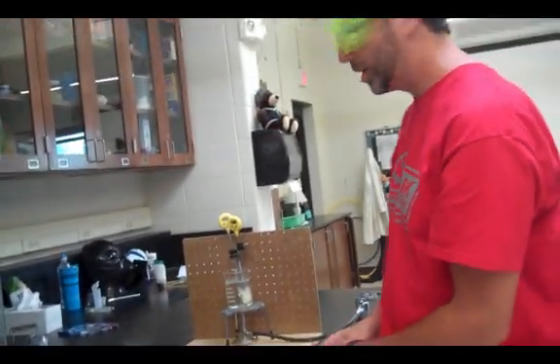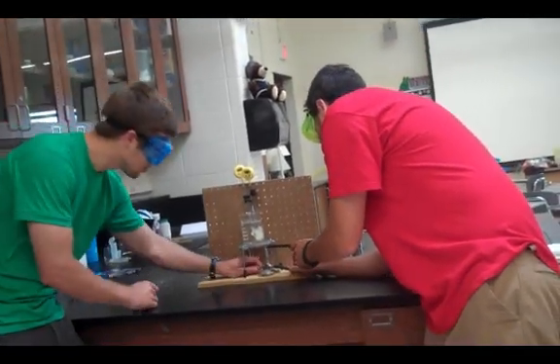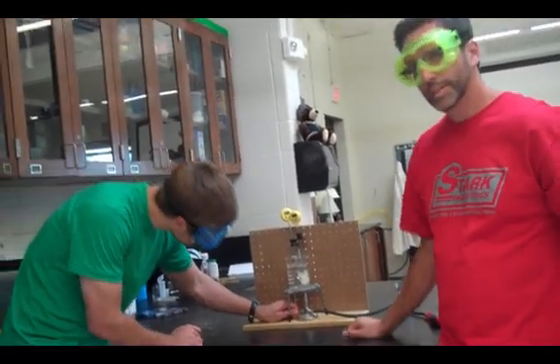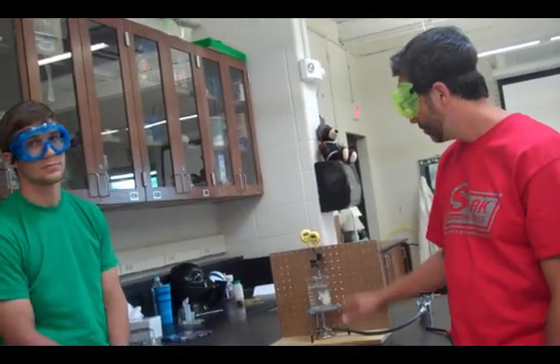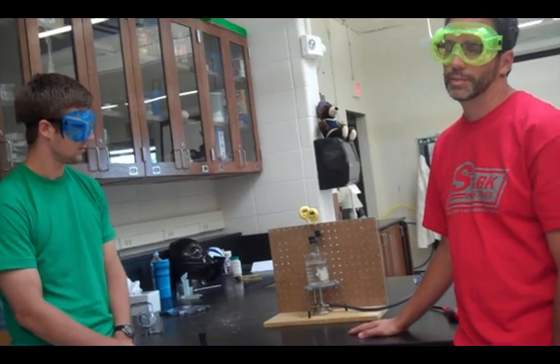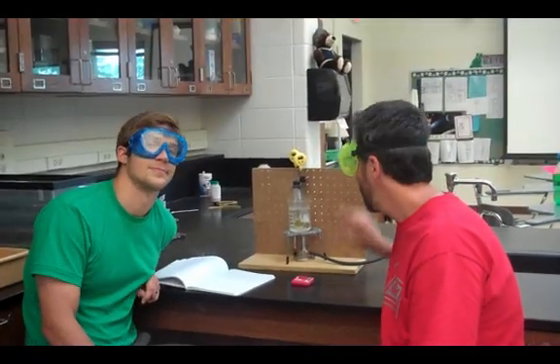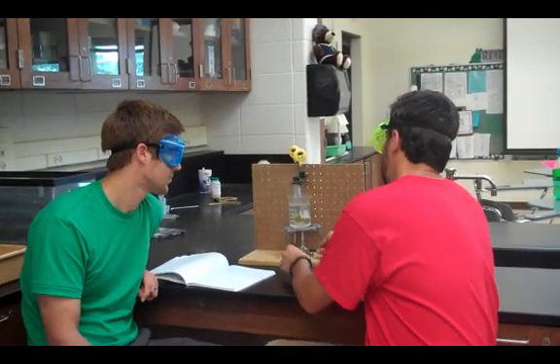Next you're going to need to melt this substance that is currently frozen solid. So you're going to have your goggles on, burner ready, gas is on, light the burner. That's a lot of water to heat up, so you can have sort of a higher flame in the beginning, but you always want to be careful and control the flame and the heat. Now that it has completely melted our solid, we're going to turn off the gas.